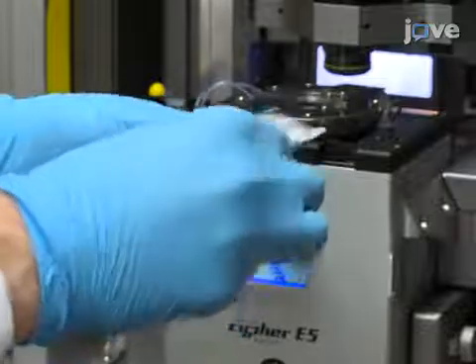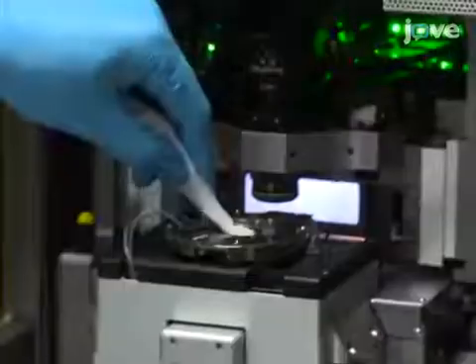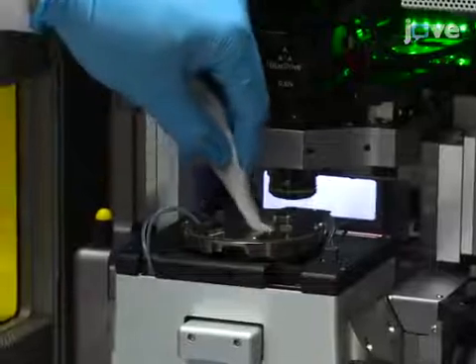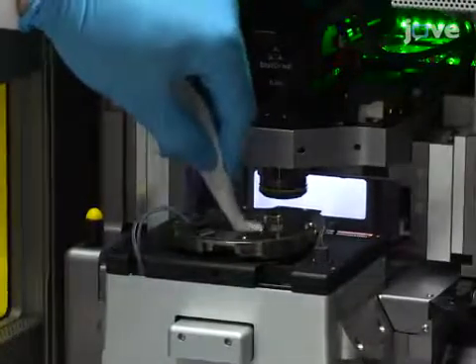Physically clean the surfaces that can't be cleaned by sonication by wiping them with single-ply low-lint tissues soaked in ultra-pure water, isopropanol and ultra-pure water sequentially. Allow the surface to dry in air for up to 30 minutes.